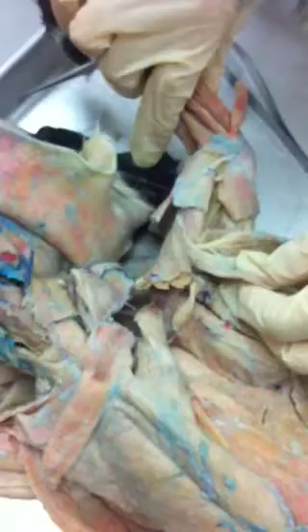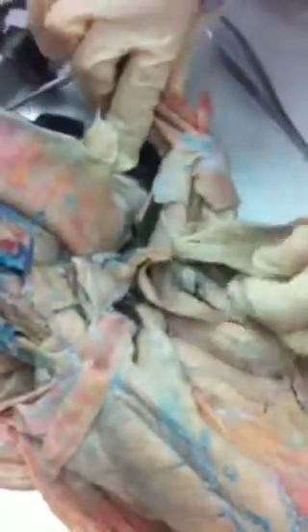So to be clear, this is the top flap of our latissimus dorsi. That's our pec major. And here we have transected something called the clavobrachialis, but we are pretending that it's part of the pec major. And here is the remaining part of our clavodeltoid.